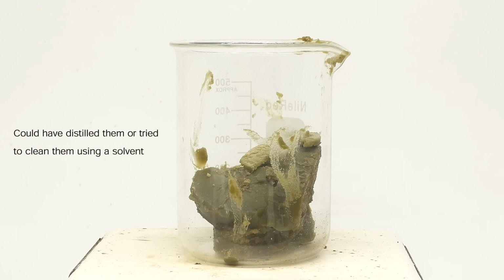In theory, they should be colorless or white, but for some reason they're green. The label said there were no dyes or colorants present, so I guess the olive oil that was used to make the soap was just not super pure. This is not at all to say that the olive oil they used was bad, it just means that it wasn't heavily refined. Anyway, now I need to connect them to glycerol to make triglycerides.